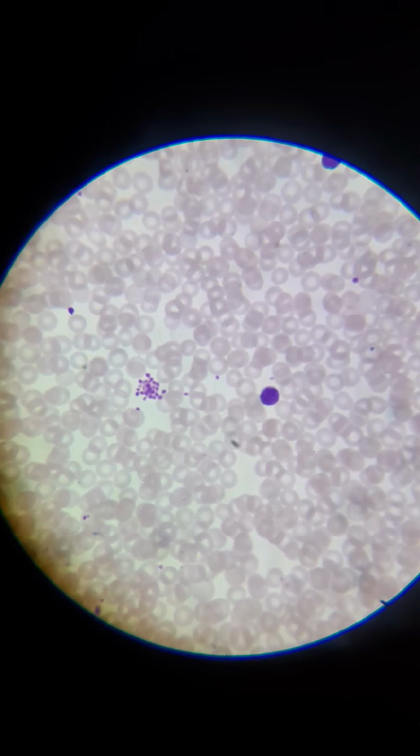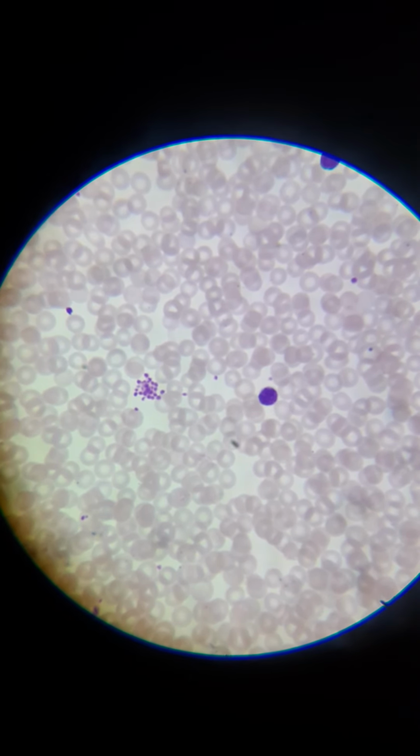These purple ones, right? There's a grainy purple one and a dark purple one. The dark purple one that's just straight dark is most likely a lymphocyte, a T cell or a B cell or something along that nature. You really can't tell, as far as I know and what I'm learning, at least not with this kind of a stain. But it's some type of lymphocyte, most likely.